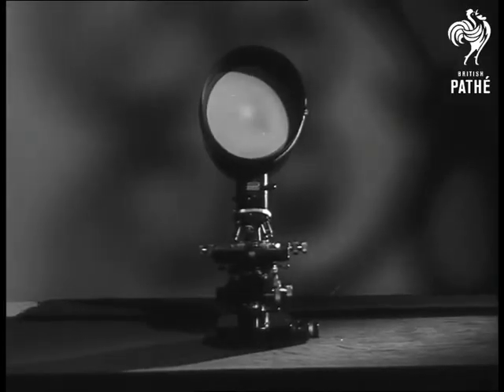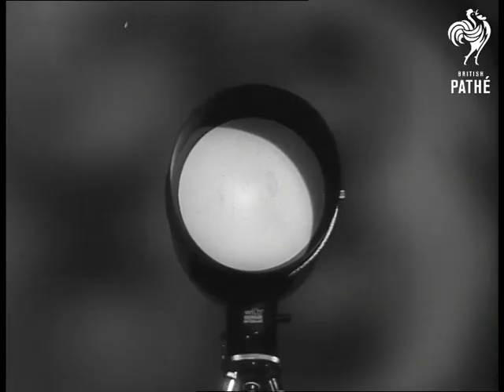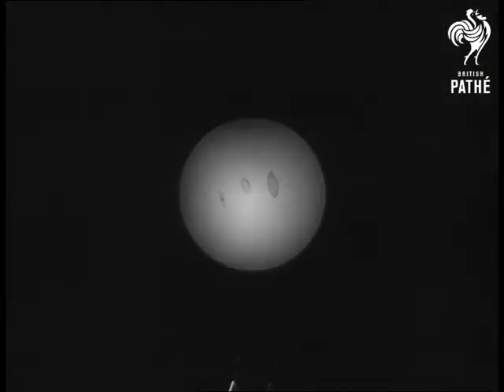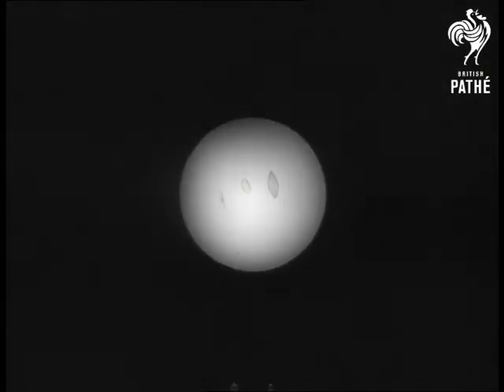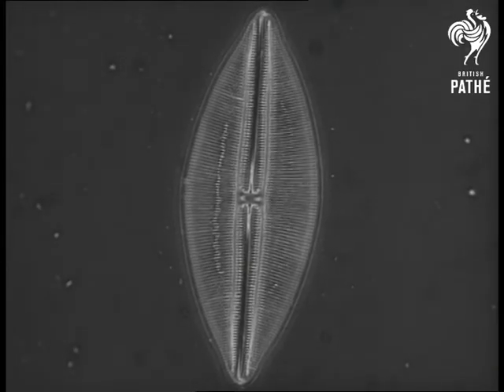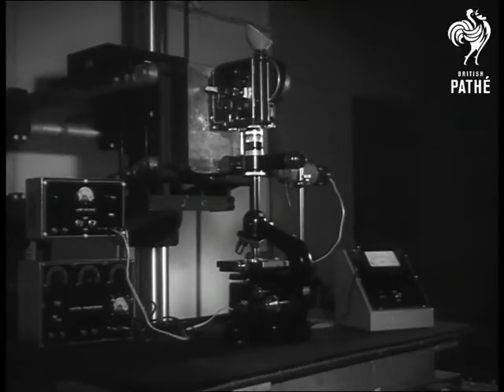This is a modern projection microscope. The image is enlarged on a screen mounted on top. A minute seashell, 300 times enlarged.